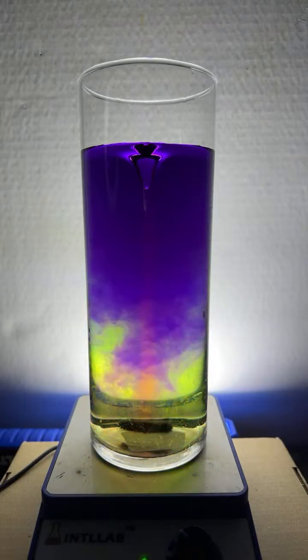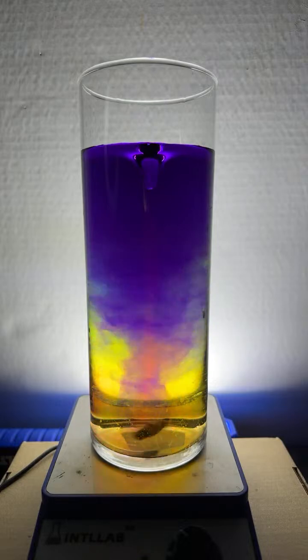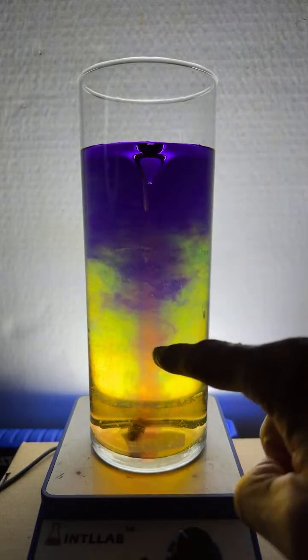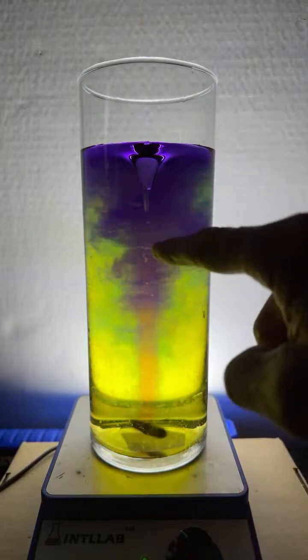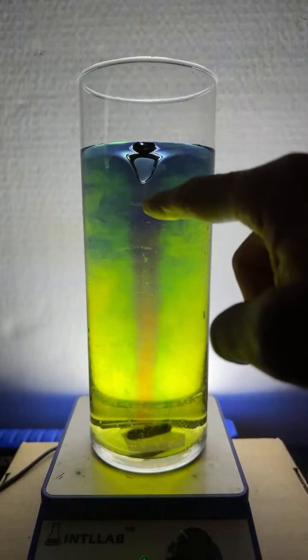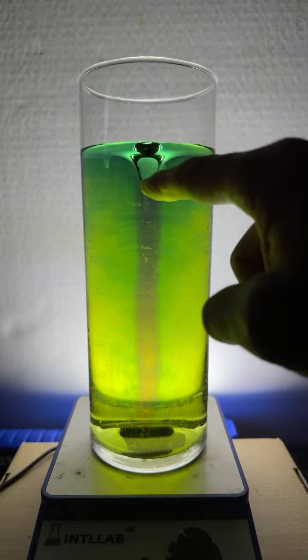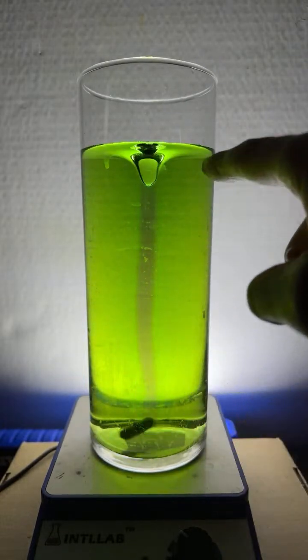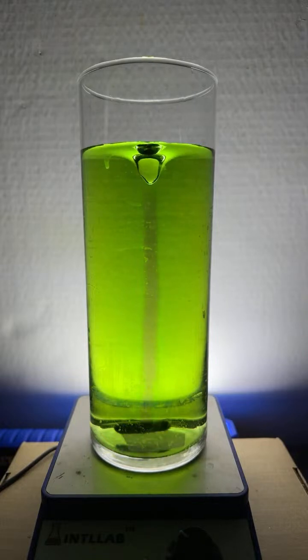And you can see the effect of the acid. You notice in the middle there, so when I add acid, it kind of stays in the vortex, or any material sort of stays in the middle of the vortex. There's a stable flow that sort of happens. But as that material gets pushed down to the bottom, it spreads out along the sides. And you can see indeed that the acid that I have added has neutralized the base.